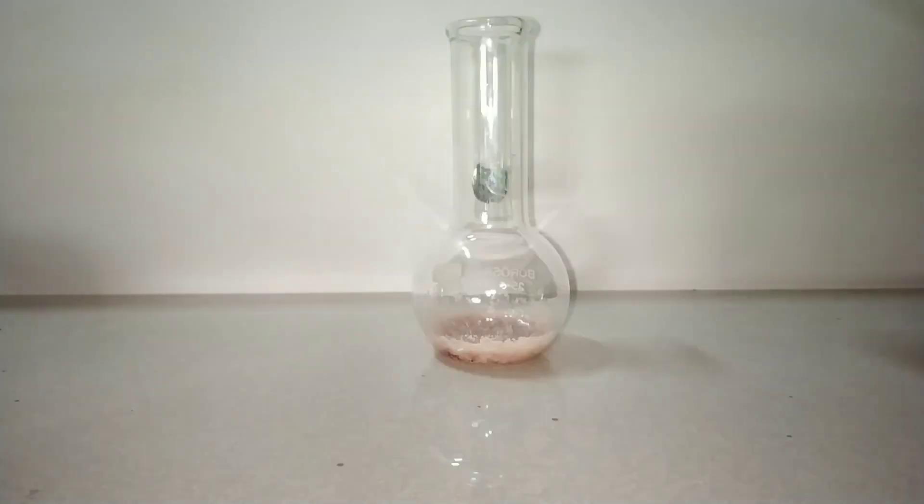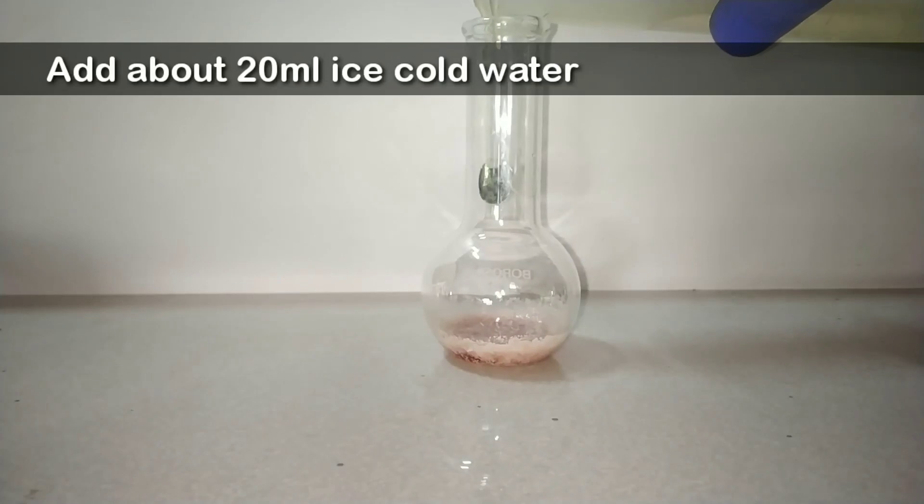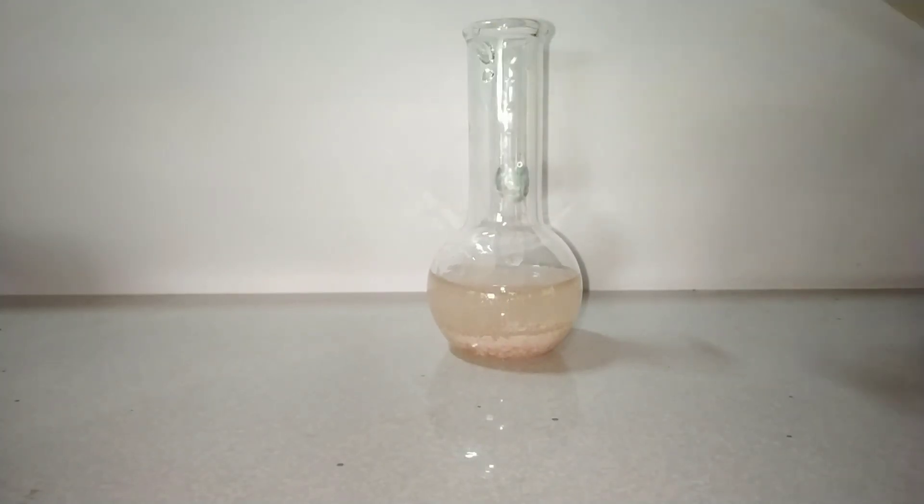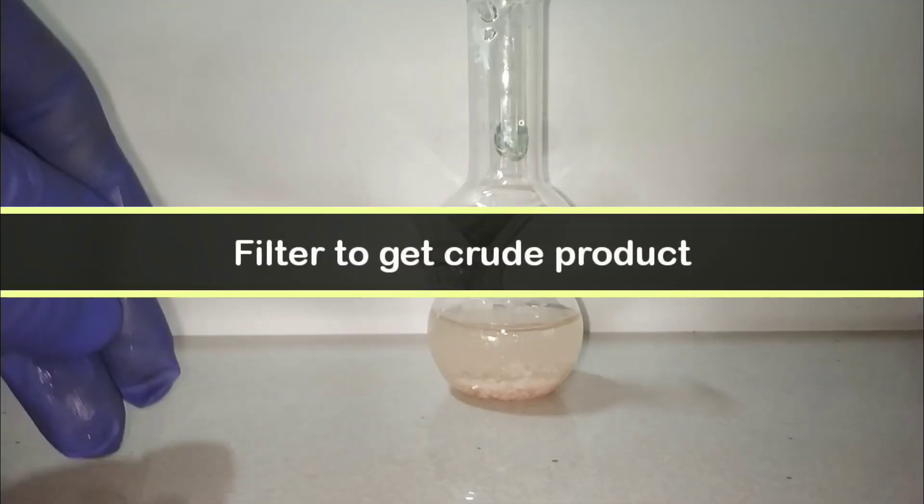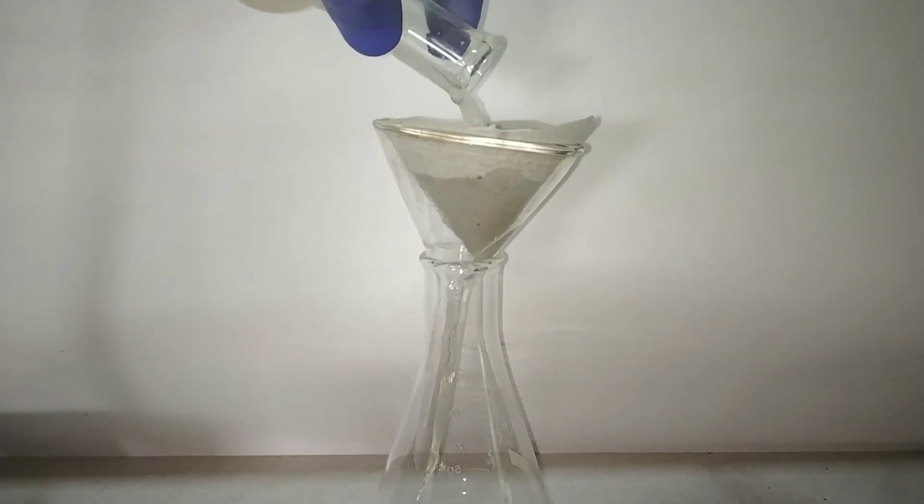Now I add about 20 ml of ice cold water to induce maximum crystallization of acetanilide. Now we filter the solution to get the crude product.